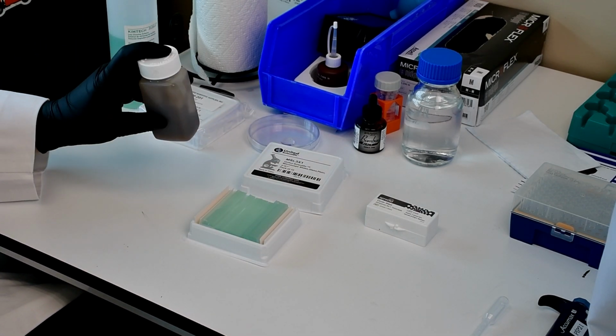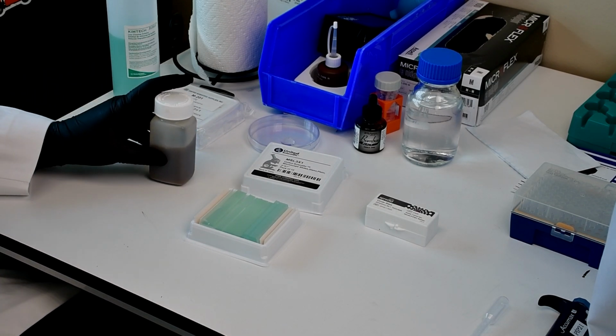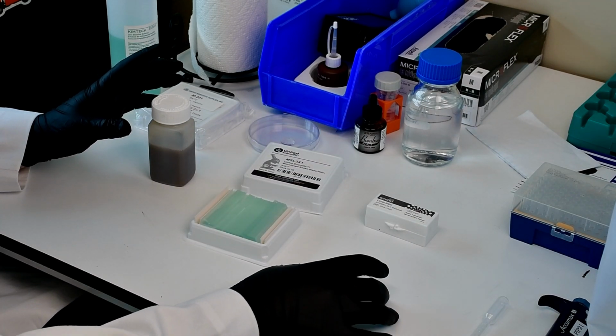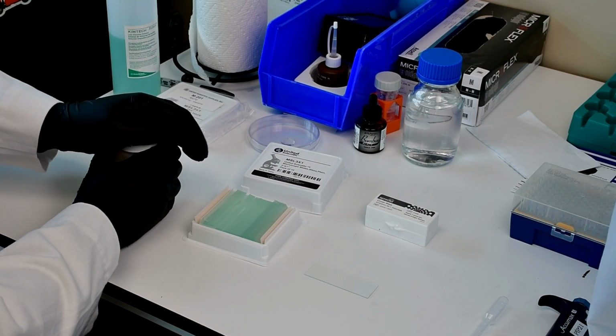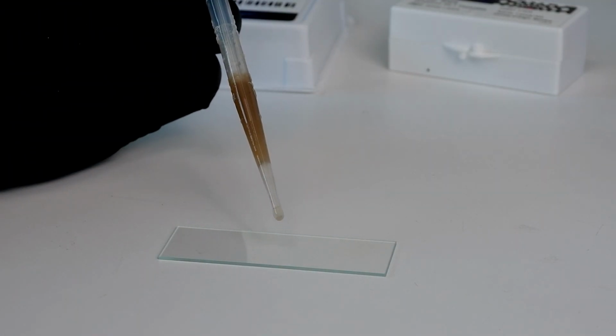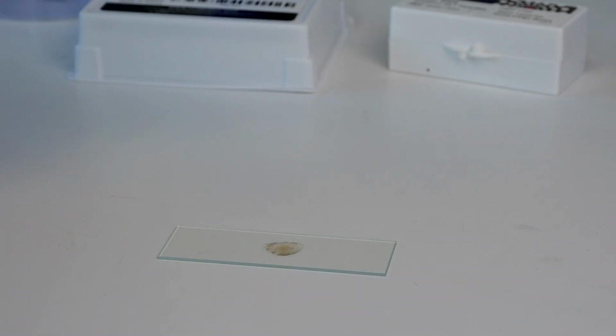I'm just going to mix this. Just gently invert. We don't want to disrupt any of those floc structures or anything. And I'm going to start just doing a standard slide prep for microscopy. So I'm going to take a little bit of sample. I'm going to put a drop right in the middle. That's all we need. I'm going to set this to the side.